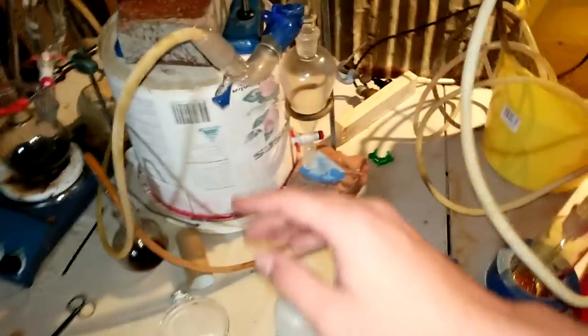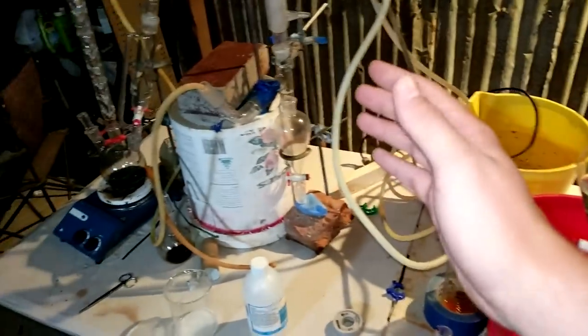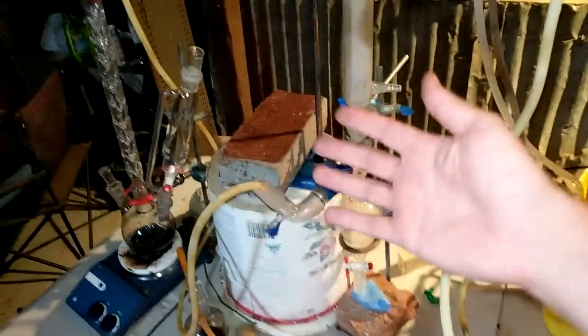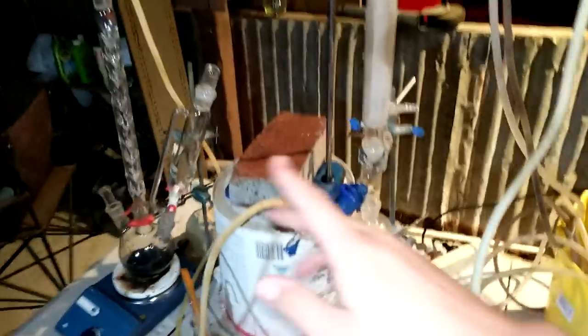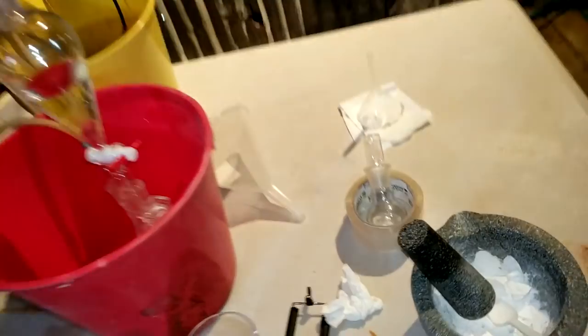I spent the first three hours, 50 mils of tertiary butanol, absolutely nothing. And then, I changed one subtle thing. I took, I decided to take this out, and that was out of one variable out of a whole lot of other things I could have decided to change. And it worked. I don't know if it's actually worked, but it worked exactly how I thought it would. You know, the chlorine mixed here, we could monitor how the different gases for the HCl coming off. You could see the mixing here and this bit of glassware got really hot and nowhere else did. Apart from that scrubber, everything worked. Tomorrow, we get to distill this.